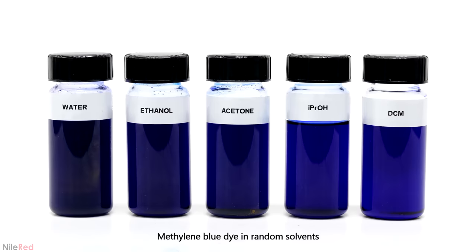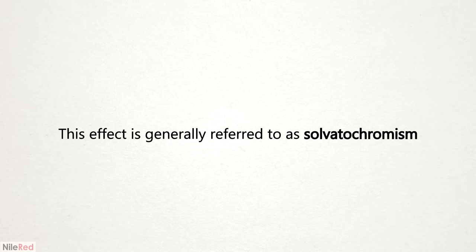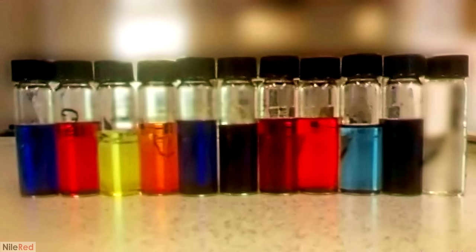Most chemicals give a pretty consistent color regardless of the solvent they're dissolved in. There are some chemicals though which are solvatochromic, meaning that their color changes drastically with different solvents. So instead we can get something that looks like this. This was a photo that I found on Wikipedia and it shows the color range of a chemical called MOED or Brooker's Merocyanine.